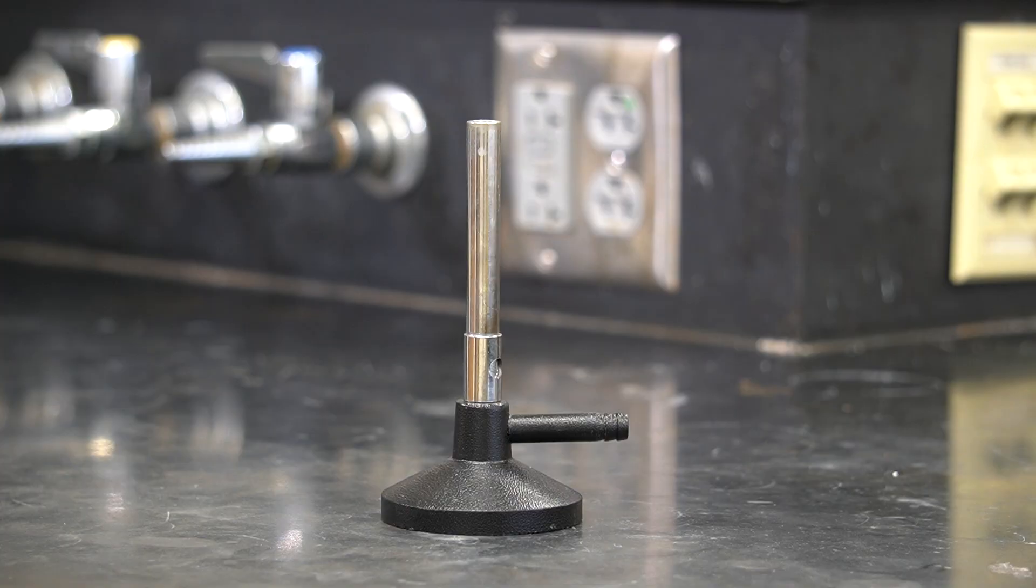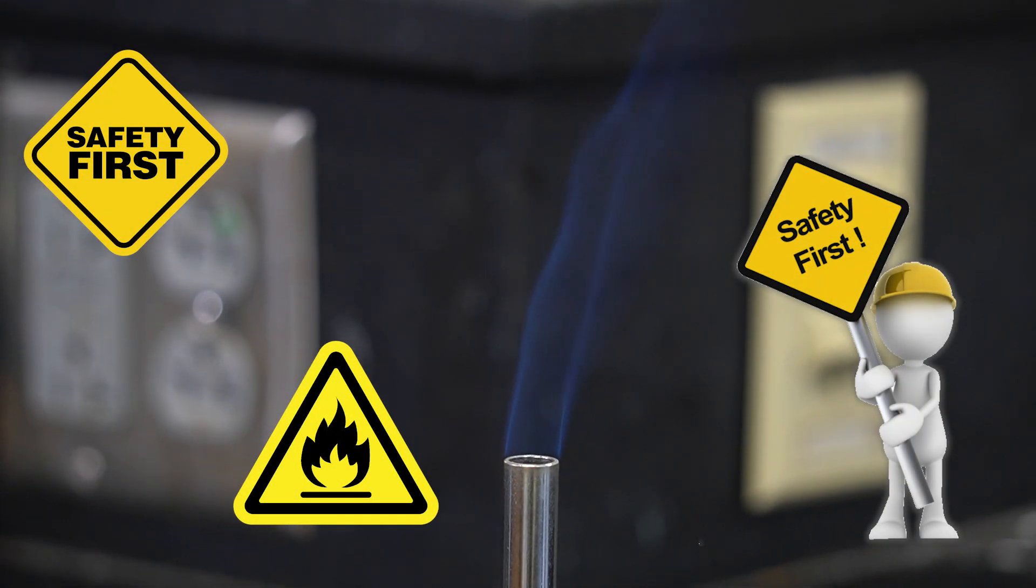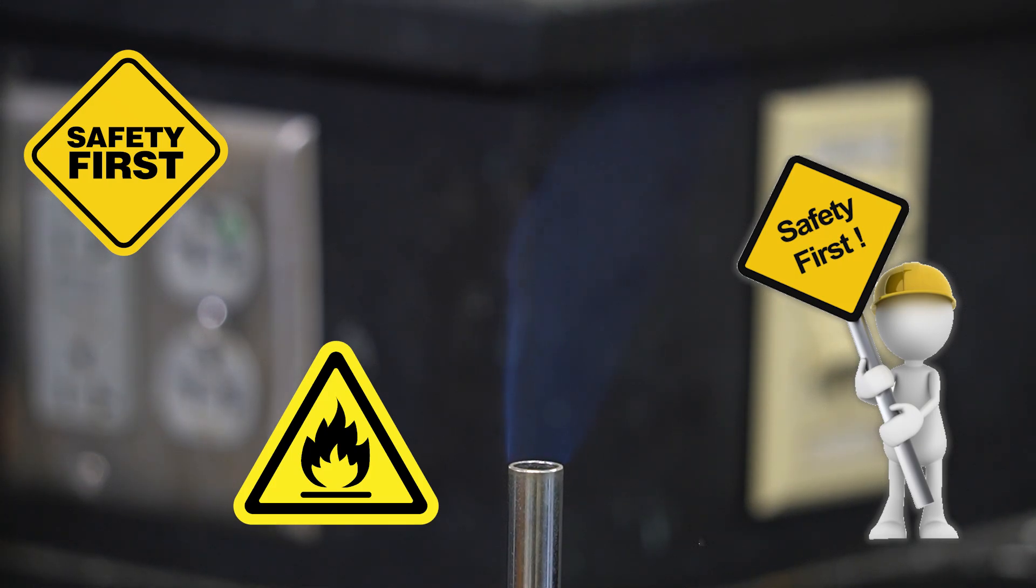Before we start to assemble and light our Bunsen burner, let's talk about safety. In chemistry labs, our utmost priority is always our and our lab mates' safety. When using a Bunsen burner, extra caution should be taken as we are working with an open flame.